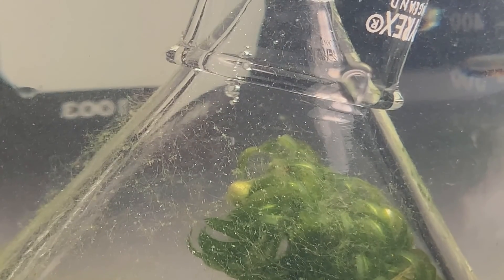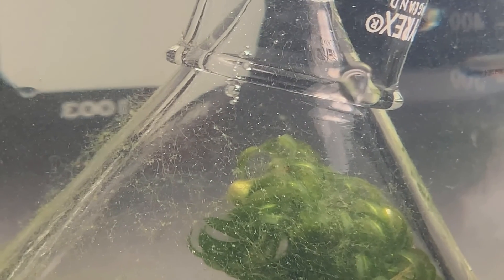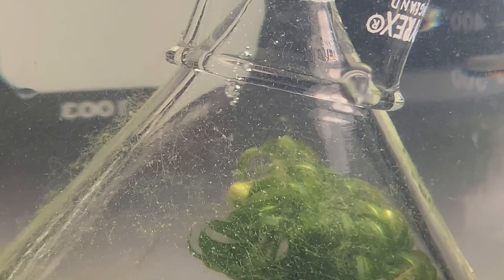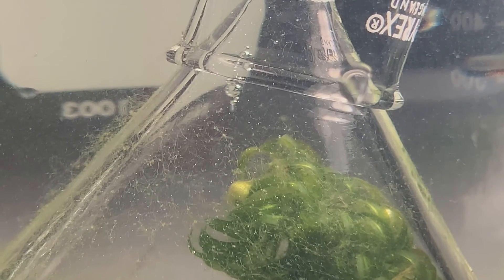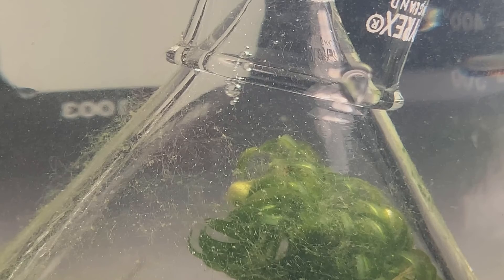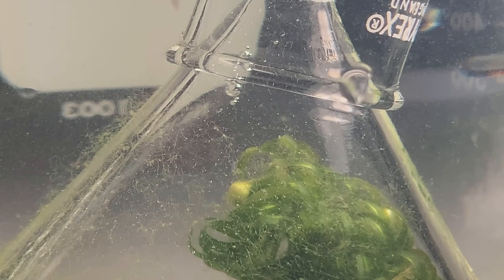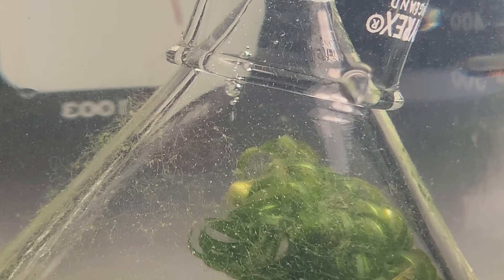This plant is 0 centimetres away from the lamp. Count the number of bubbles produced in 30 seconds and double it to find the number of bubbles released in one minute, then record this in a results table.